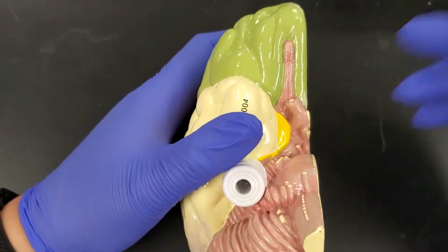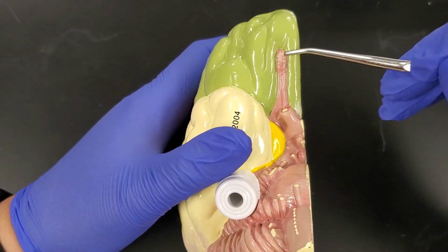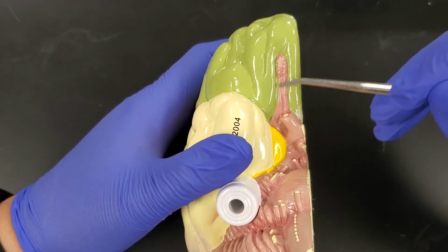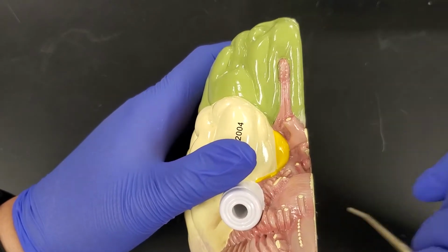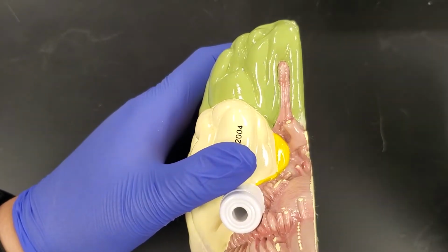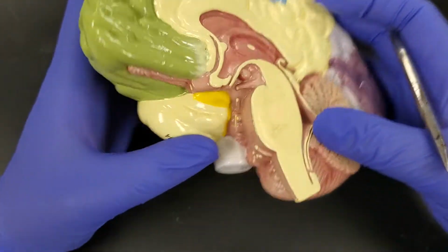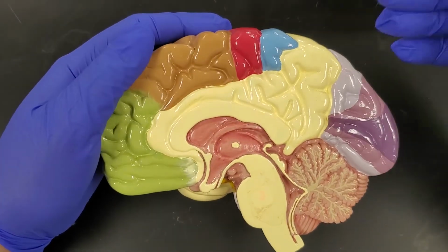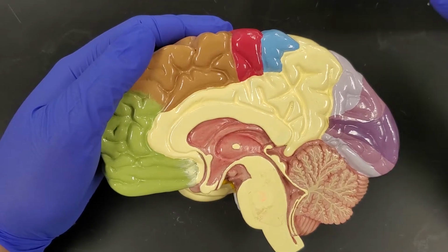Another thing we're going to see on the sheep brain is this structure right here. This is called the olfactory bulb. The olfactory bulb is actually part of the olfactory nerve. It goes into the olfactory nerve, and that is for the sense of smell. And we're going to notice a big difference in the size of the olfactory bulbs between sheep and humans. One of the things that you're going to notice is that the structures might be slightly larger or slightly smaller on the sheep brain, and depending on how big the structures are depends on what we're using it for.